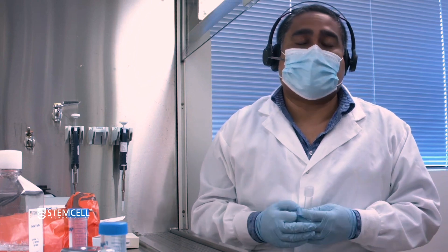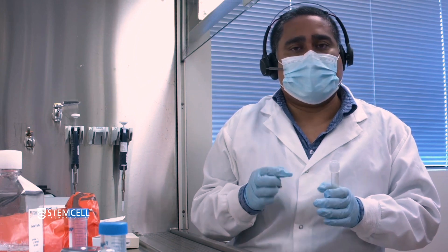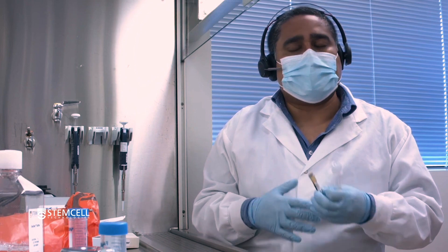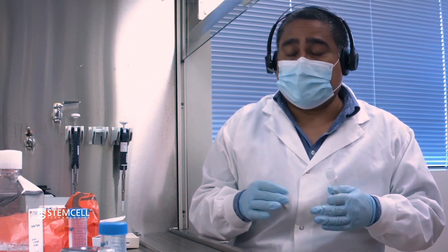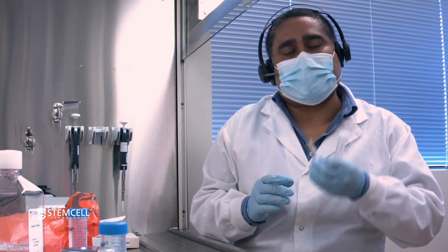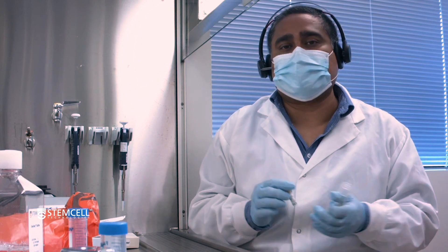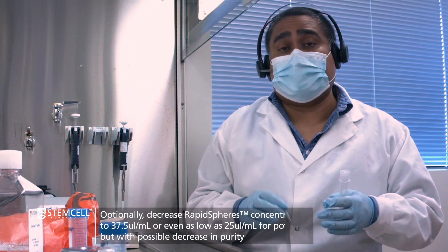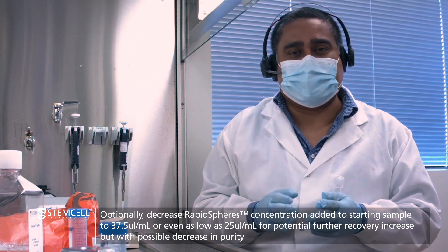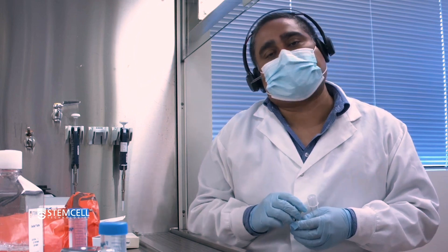Today we went through using the 17955 NK kit to do the isolation, as well as touched on how you can do the resuspension and reseparation to try and skew towards slightly higher recovery. As a bonus suggestion, if you're the type of lab that really needs to further increase recovery, something else you could consider — although this could come at further expense to purity — is to titrate down how much of the dextran rapid spheres are added. Using the example of the 17955 kit, which normally calls to add 50 microliters per ml, you could elect to add only 37.5 microliters per ml, or if you really want to skew towards higher recovery, you could add only 25 microliters per ml.